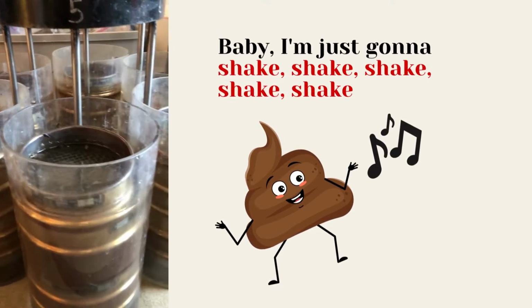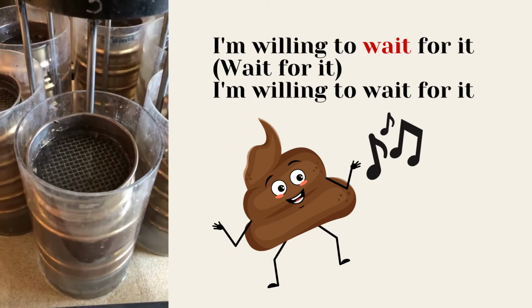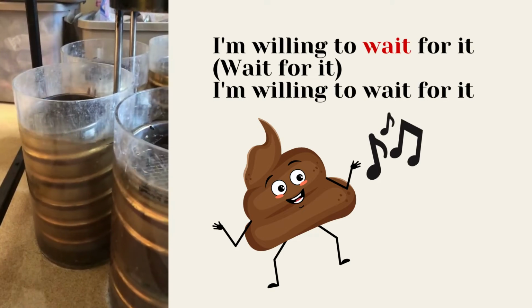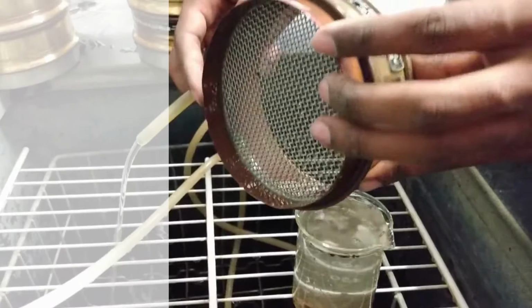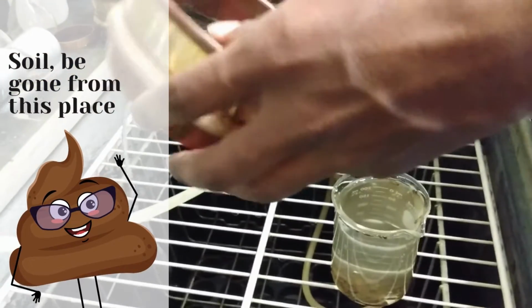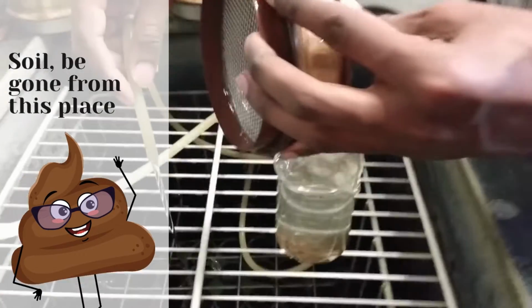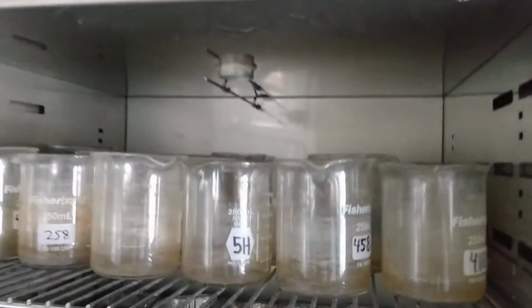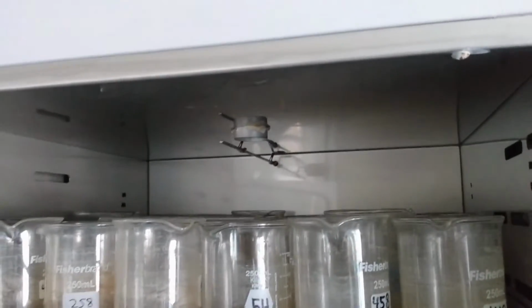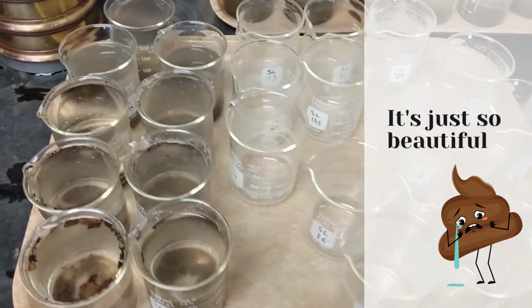We're going to let it soak. Then we'll start the sieving and shaking process. For 10 minutes, we're just going to let them shake, and the particles will start falling through the sieves. And then we're going to take out all of the soil that's on the different sieves, dry it, and weigh how much was left in the first sieve, and the second sieve, and the third sieve, and so on and so forth, all the way down to the bottom. And then we'll calculate the mean weighted diameter.